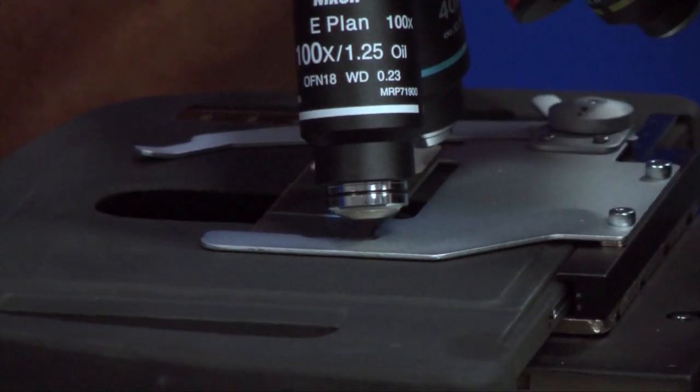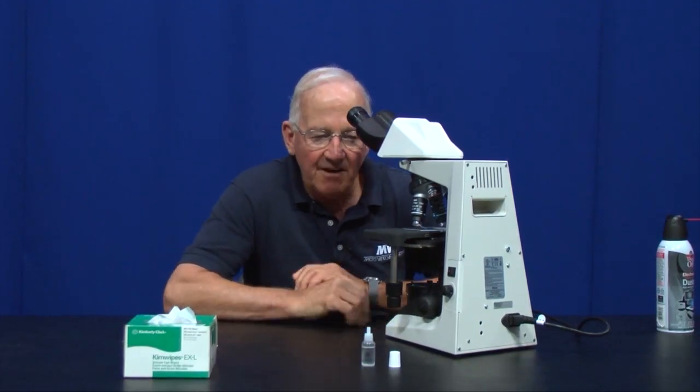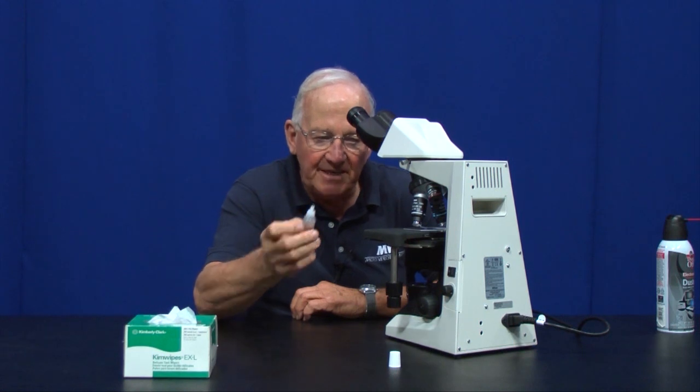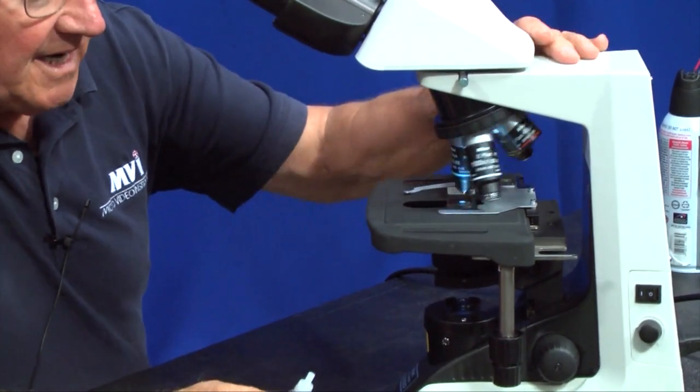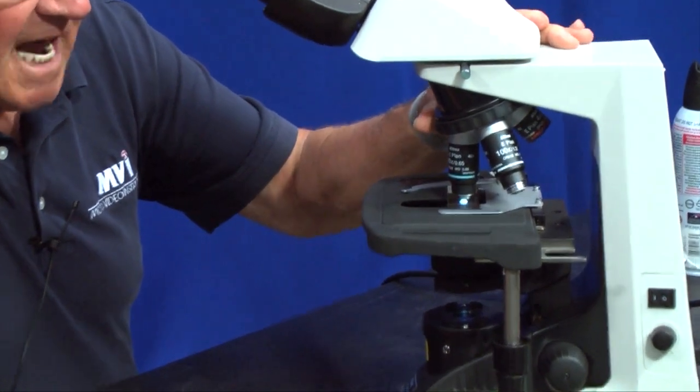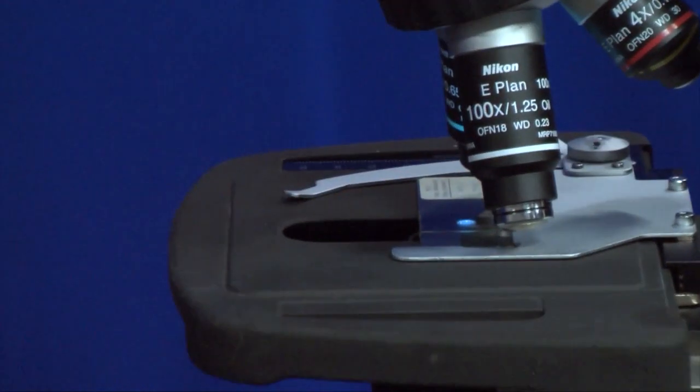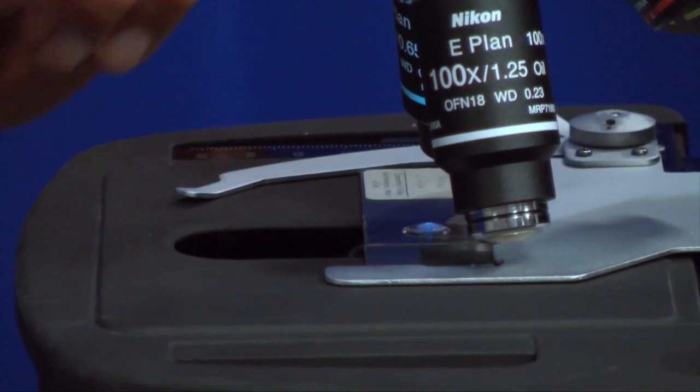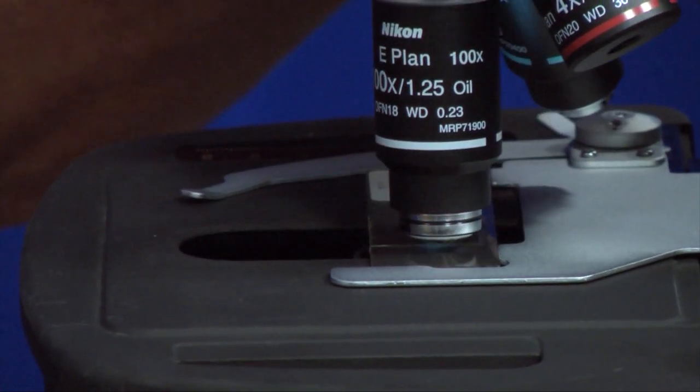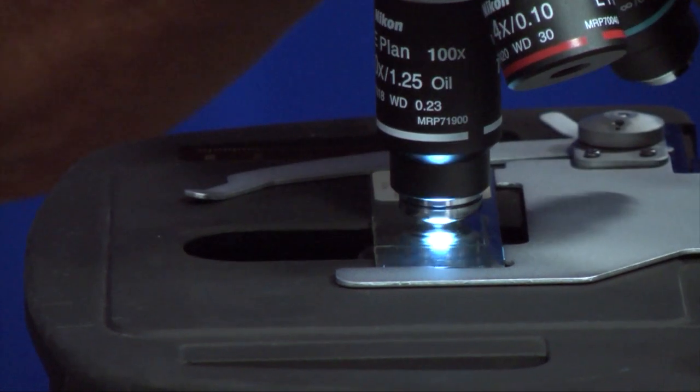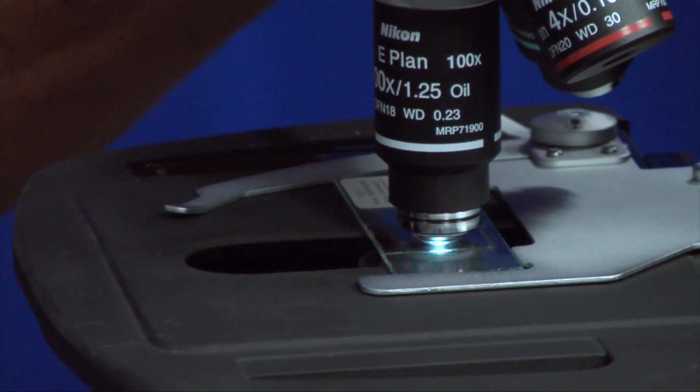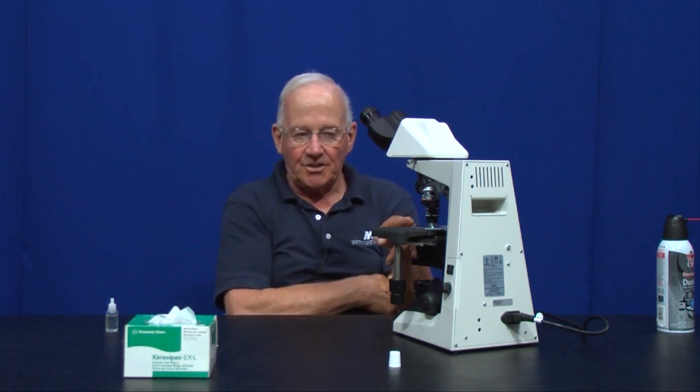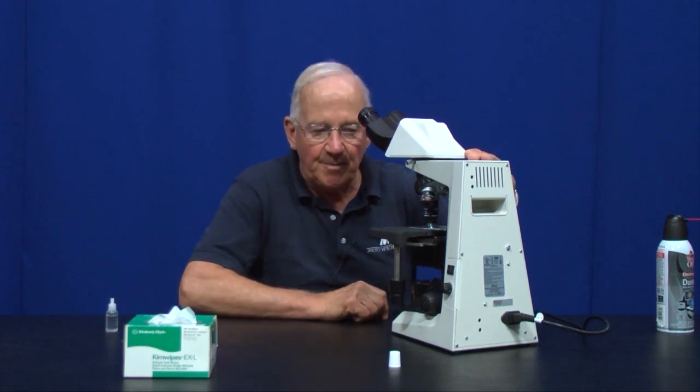Now we're going to the 100x objective, and that is an oil immersion lens. You have to use immersion oil, which comes in a little bottle like this. You have to use immersion oil between the slide and the objective. This is how you do it. You go from the 10 to the 40, you're in focus. Now we're going to go to the 100. You move the 40 out of the way just a little bit and put a drop of immersion oil on the slide where the light is coming through the condenser. You move the 100x objective into the immersion oil and past the immersion oil like so. What you're doing is getting any air bubbles out of the immersion oil. Now when I look in here, I'm in focus. I am now looking at 1000x magnification with a 100x oil immersion lens.